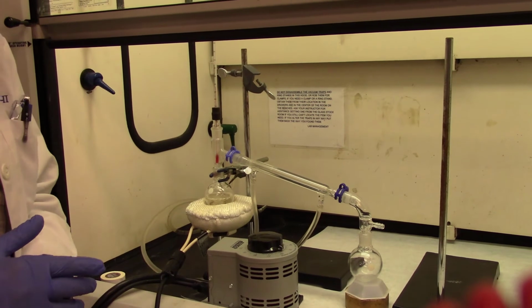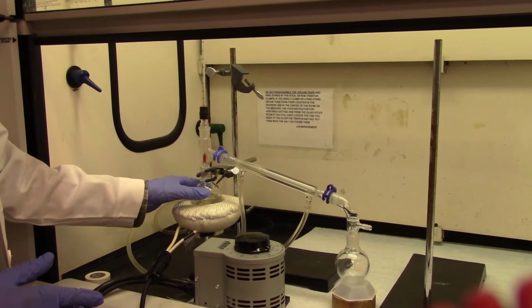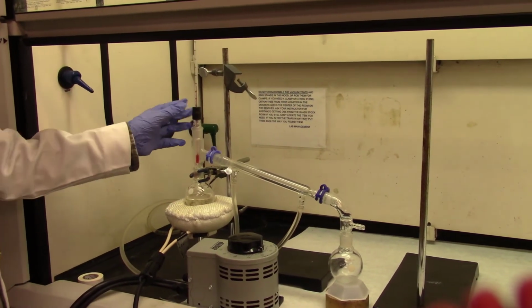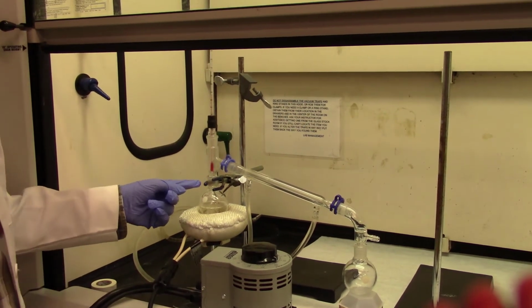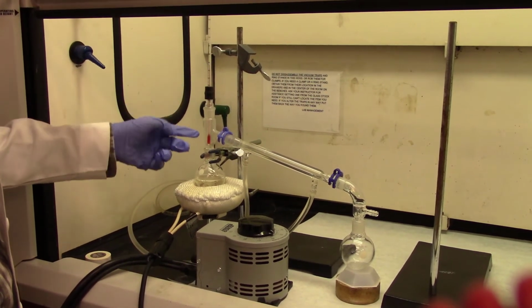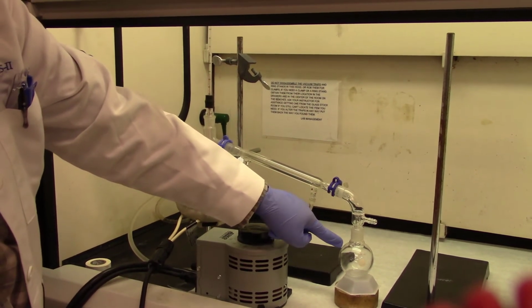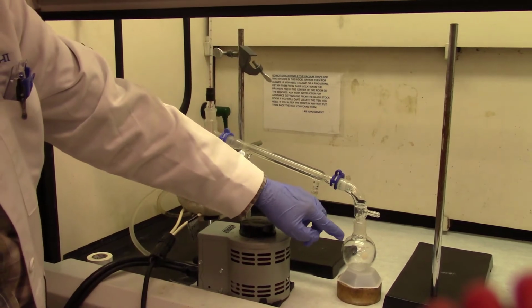So remember, we collected about 45 ml, three combined extractions of caffeine. I have transferred those caffeine extractions into a round bottom flask. I'm using simple distillation that I'm familiar with from your first experiment. So this is a round bottom flask fitted with a 3-way connector, a thermometer and thermometer adapter, and the condenser, and you are collecting the distillate. So it will take about 15 minutes to completely distill off DCM.